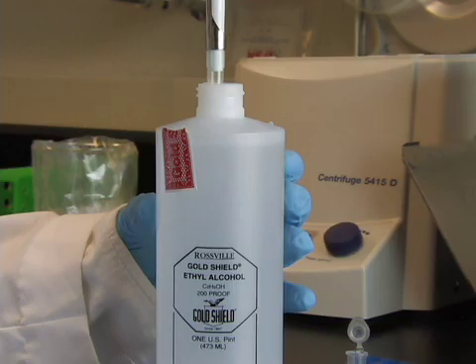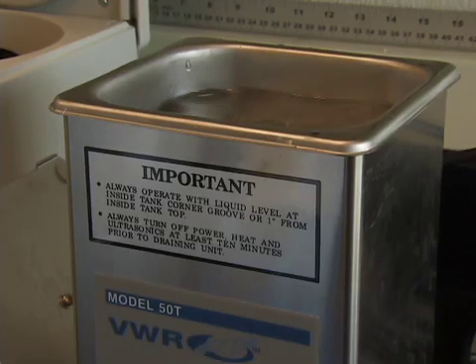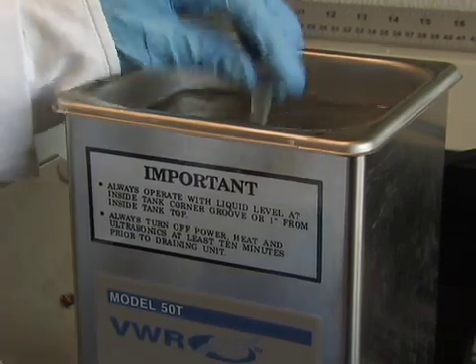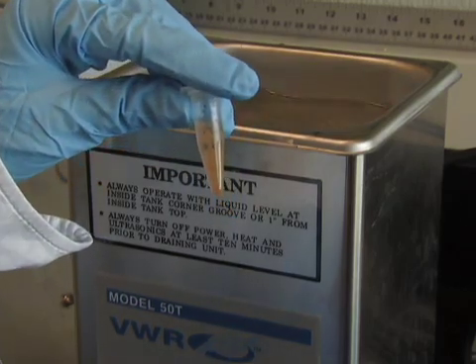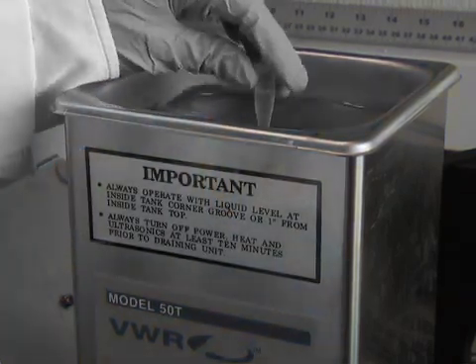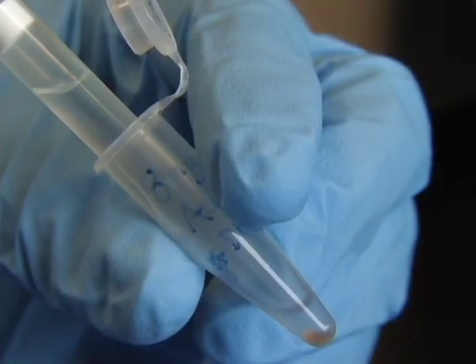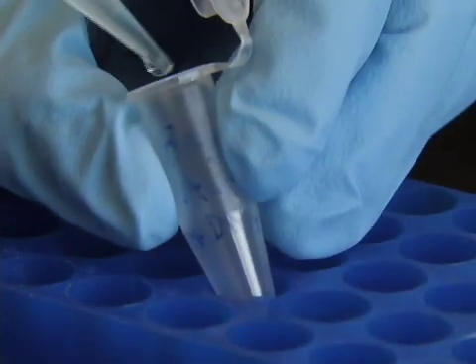The gold particles are then washed in 1 ml of brand new ethanol and sonicated briefly. Once the DNA precipitates, it tends to cause the gold to clump. A light sonication breaks up these gold clumps. But be careful not to shear the DNA by over-sonication. The gold pellets are spun down again and the ethanol is removed by pipetting. Repeat the ethanol wash two more times.